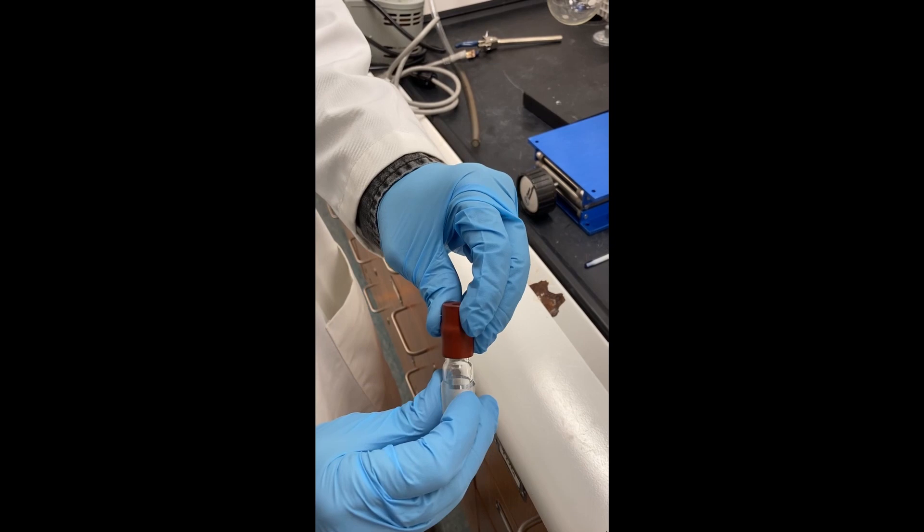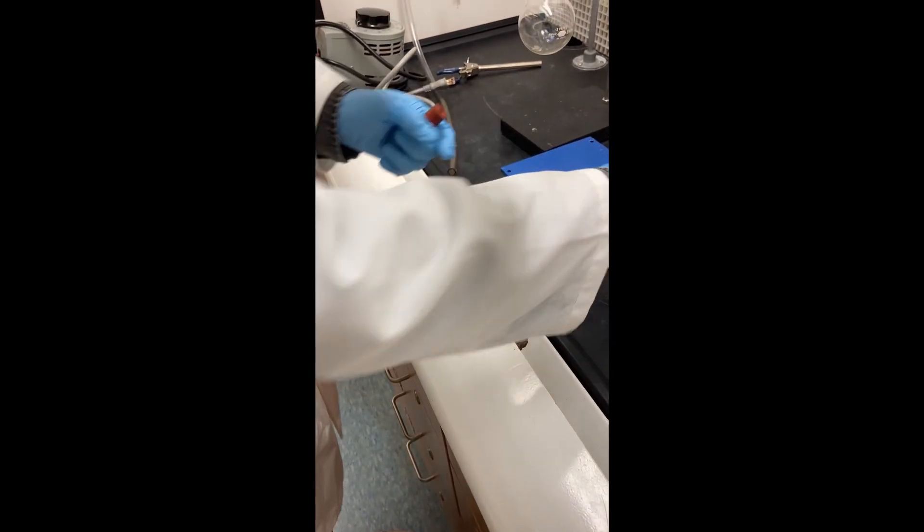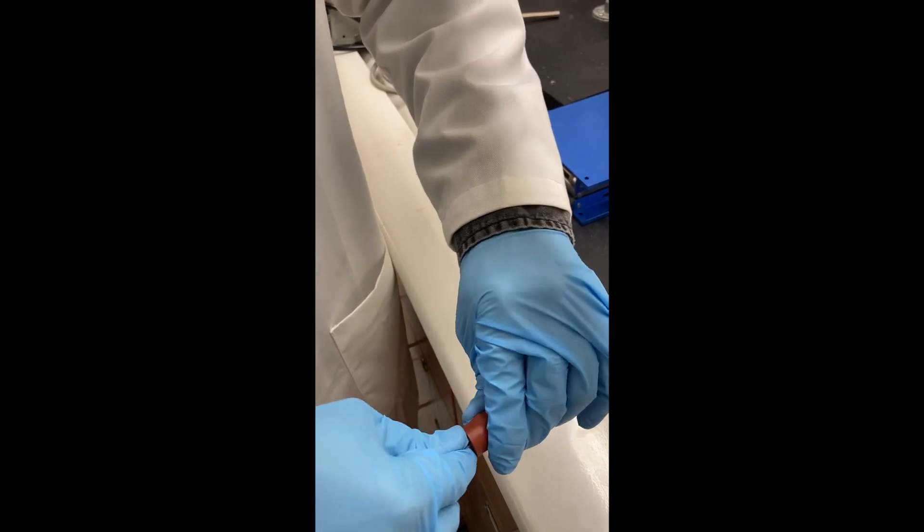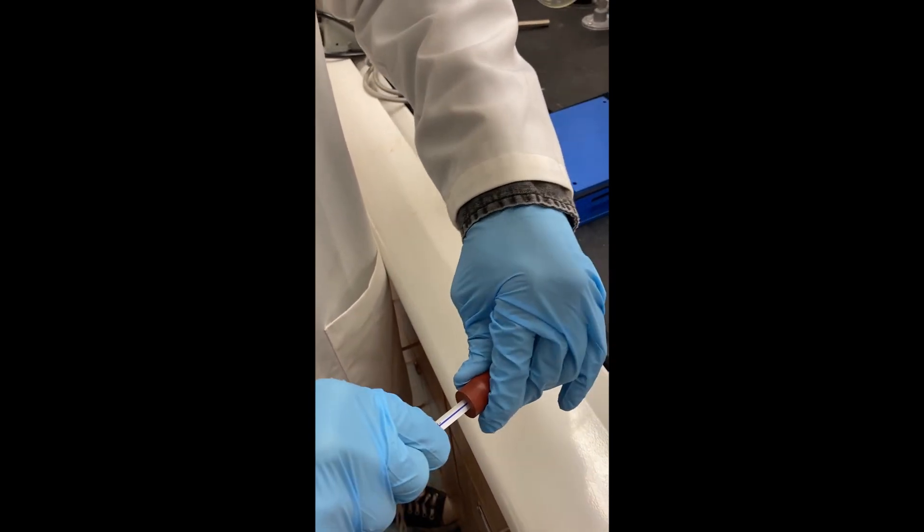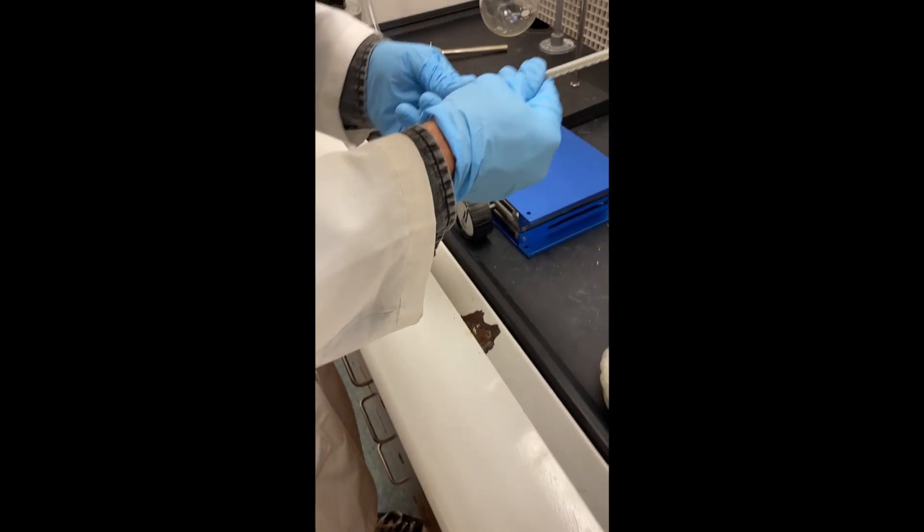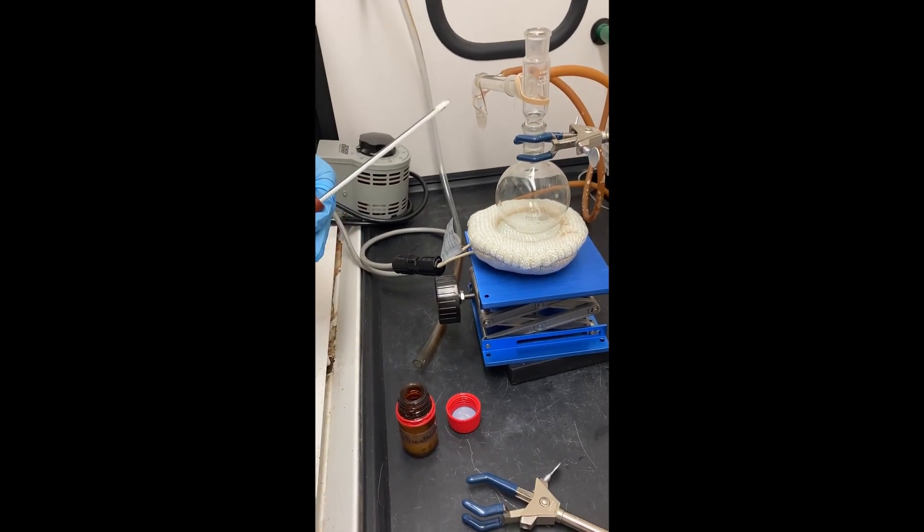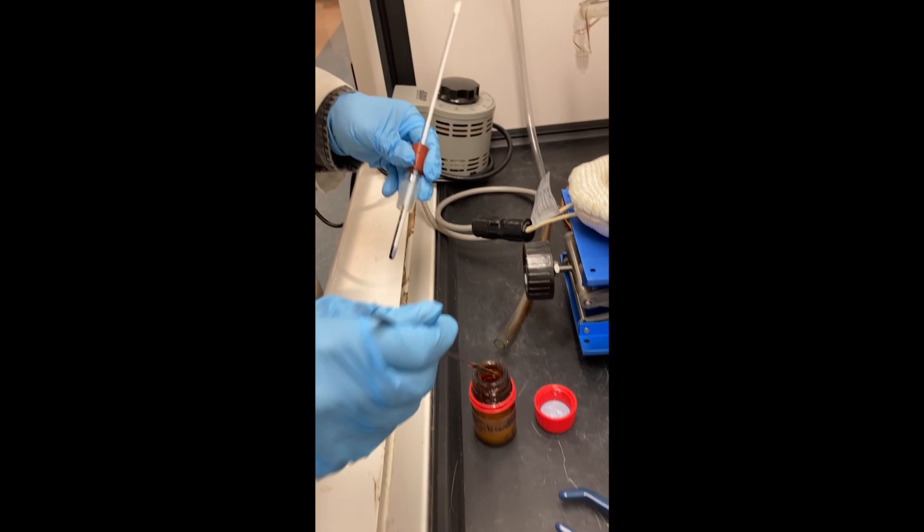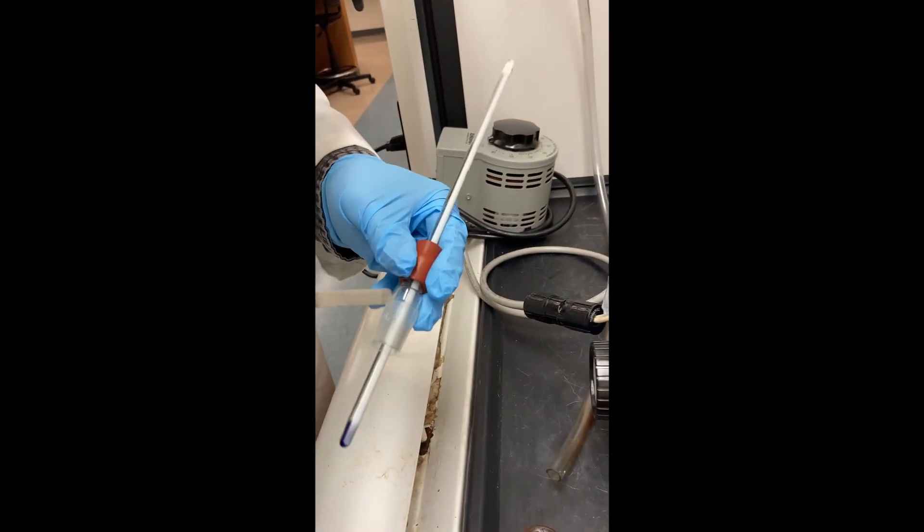Be careful when assembling your glassware. Take extra precaution while using your thermometer and septum. Be sure to use grease in between the joints of your glassware. There should be four joints in total on this apparatus.